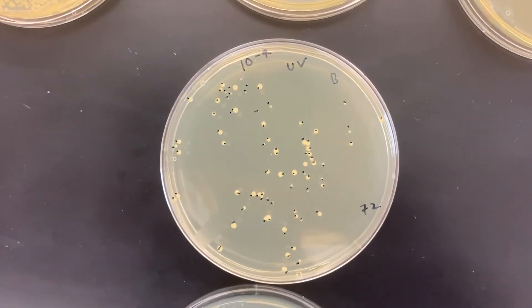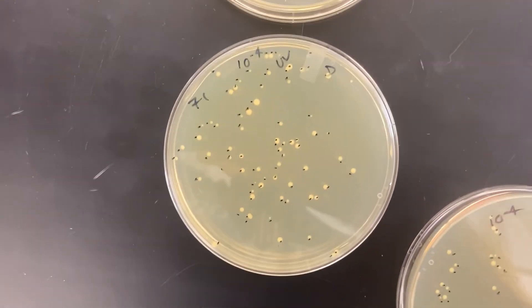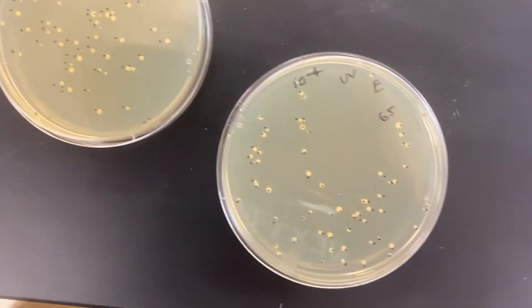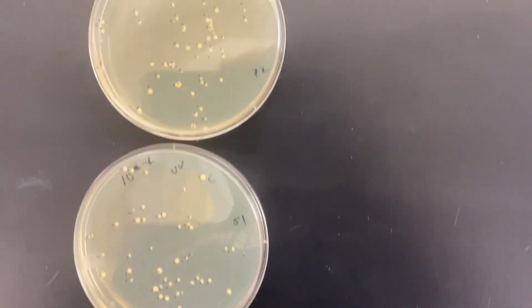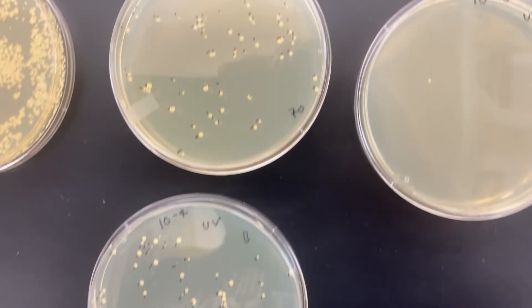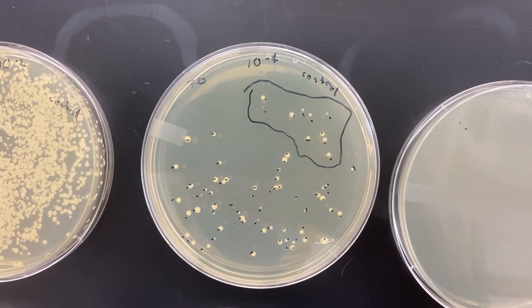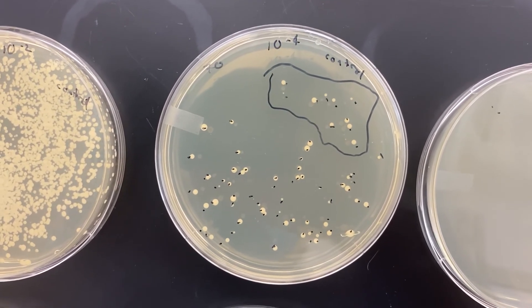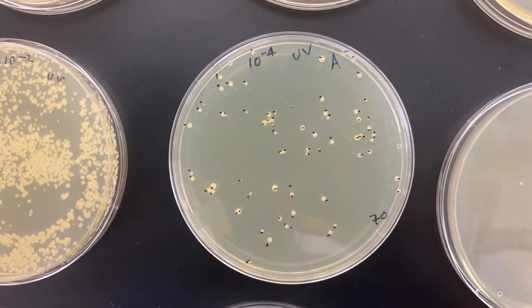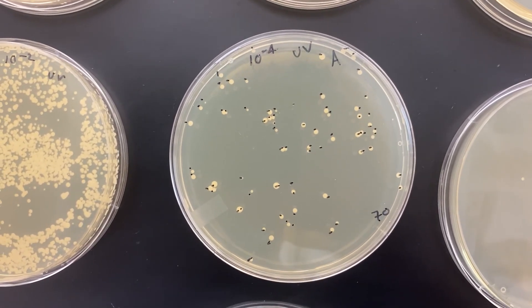At this point, if I were to calculate the survivability curve — maybe I'll have you do that — there's probably not strong evidence for cells being mutated so severely that they died as a result. So this tells me that I didn't just cook my cells using the UV light. But we may still be able to see some evidence of mutation as we run them through the tests we're going to do.